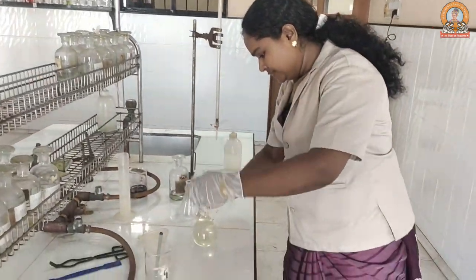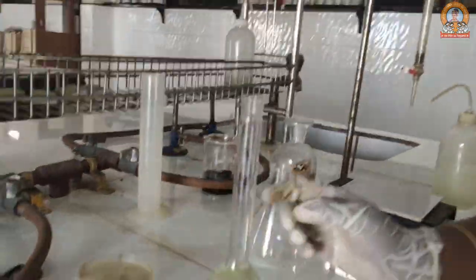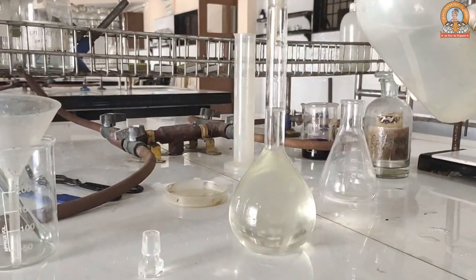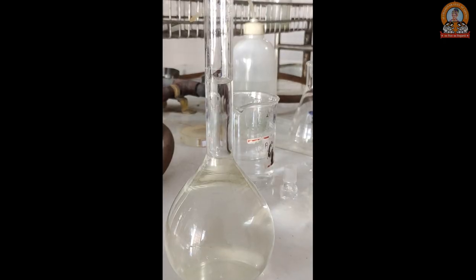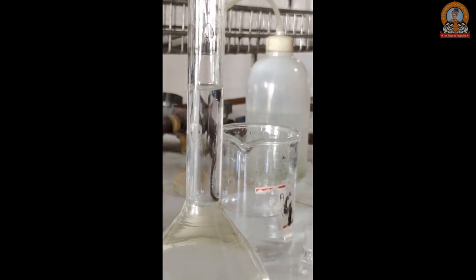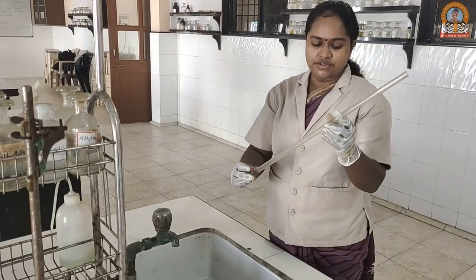Then you have to bring the water level to the calibration mark, which is the 250 mL calibration. Just below it, bring your water level, and with the help of a dropper, bring the solution nearer to the calibration. Please ensure the lower meniscus comes and touches the calibration mark.